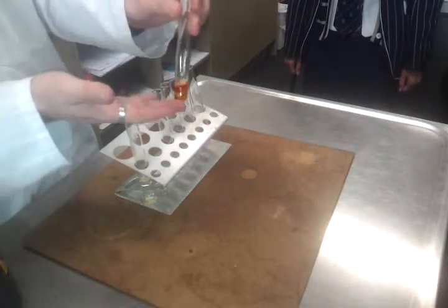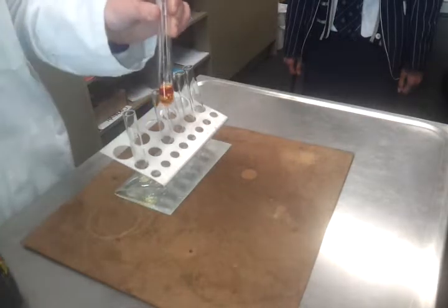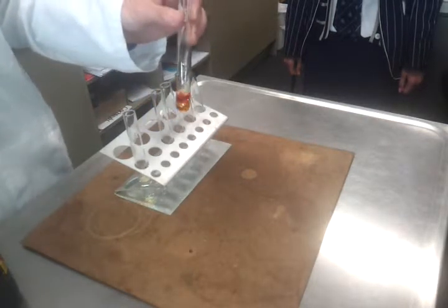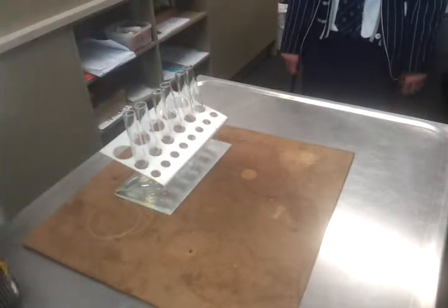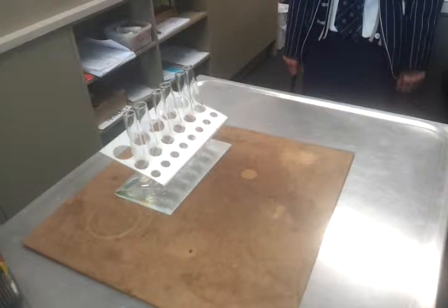So the colour has been pulled out of the aqueous layer because it dissolves better in the cyclohexane, but it's not actually reacting. I'd need ultraviolet light, and if it was reacting, if it's replacing a hydrogen, then that means it would be making HBr. And HBr is an acidic gas, just like HCl is an acidic gas. So I've got a test here. Let's see if it actually is reacting. I've got litmus paper.